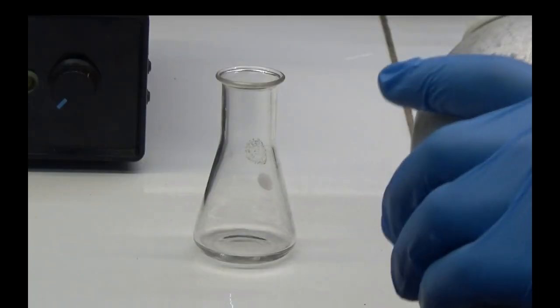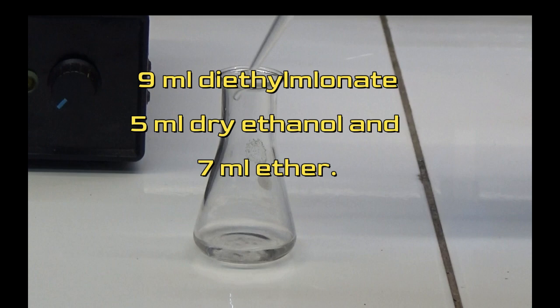Prepare a solution with 9 milliliters diethylmalonate, 5 milliliters dry ethanol and 7 milliliters ether.